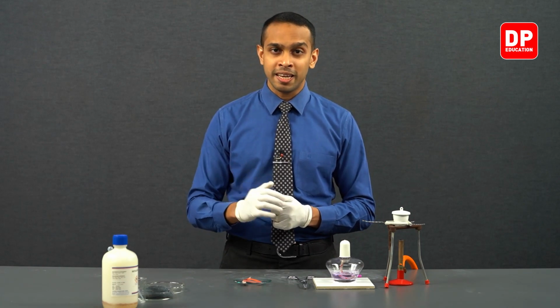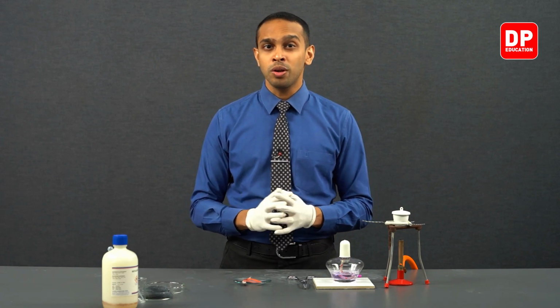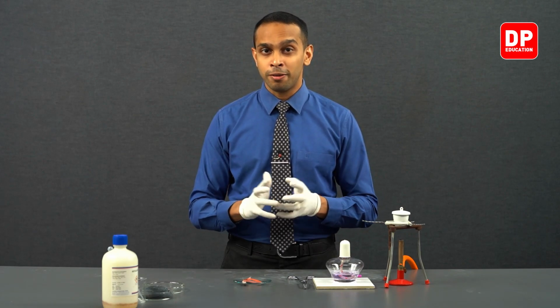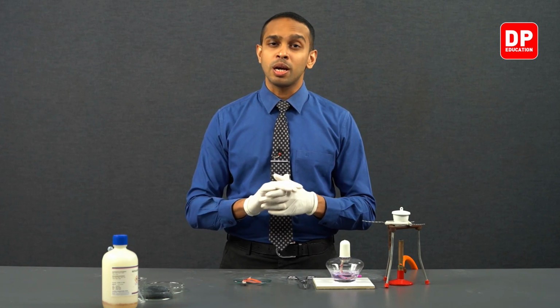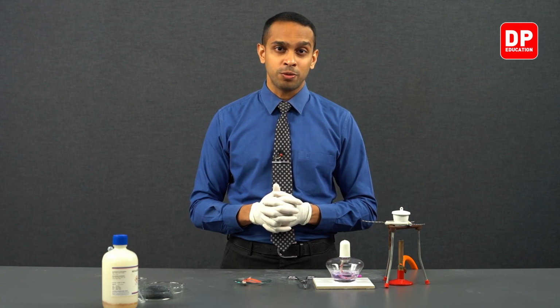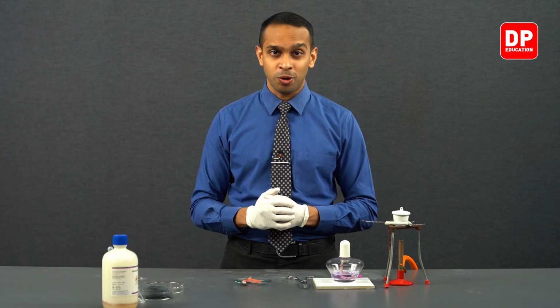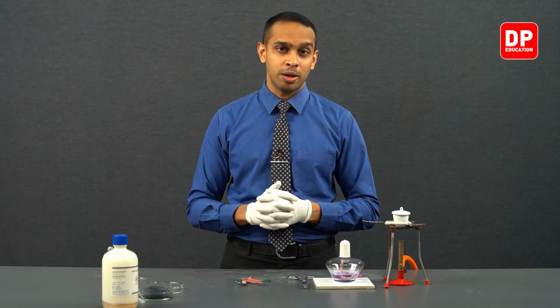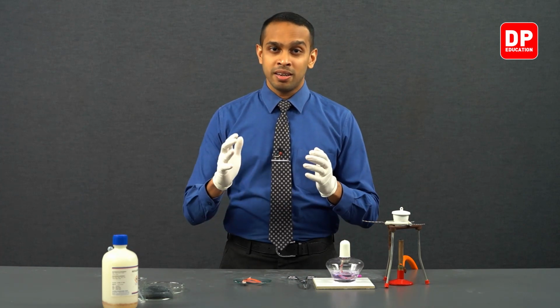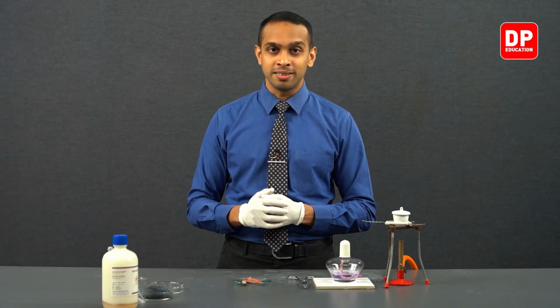water, and take a red litmus paper and observe how the solution that is formed is going to be alkaline. So therefore, the red litmus paper will turn blue when you take a small portion of the solution that is formed when magnesium nitride is reacted with water. You have ammonia formed at that point. So the ammonia solution, when tested with red litmus paper, will turn blue.